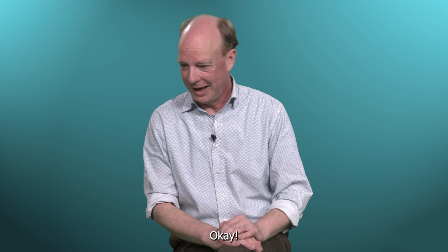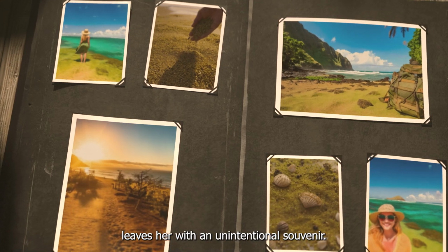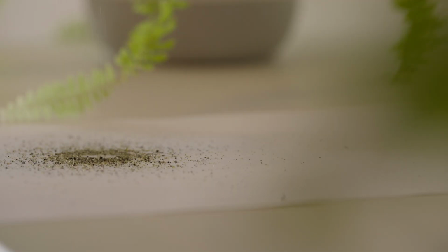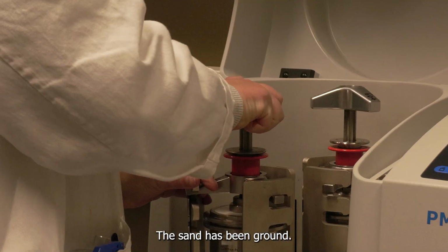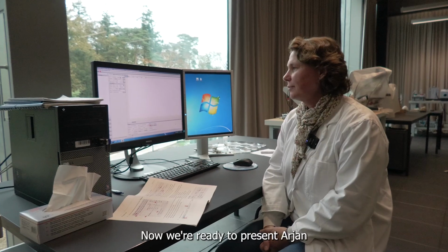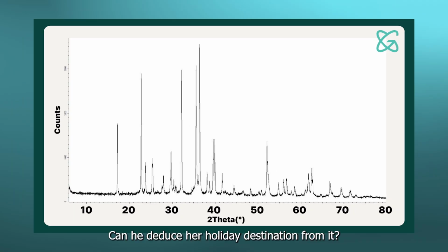Let's go. Okay. In this episode, Emma's adventure to some rare green beach leaves her with an unintentional souvenir. Stubborn sand hidden in her backpack. The sand has been ground and put through the XRD. Now we're ready to present Arjan with its diffractogram. Can he deduce her holiday destination from it?